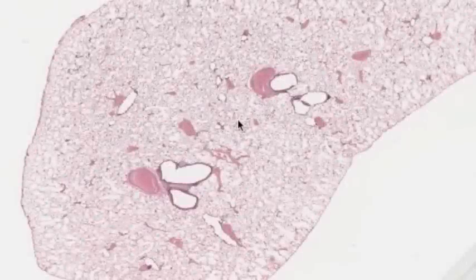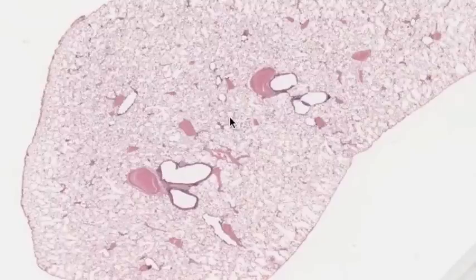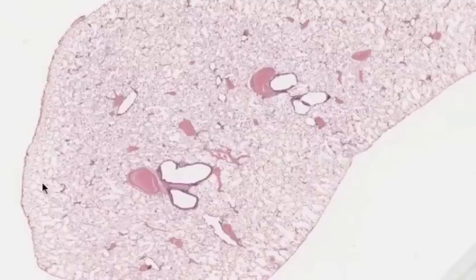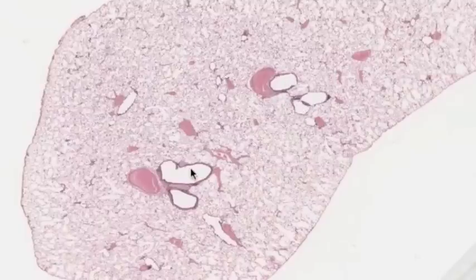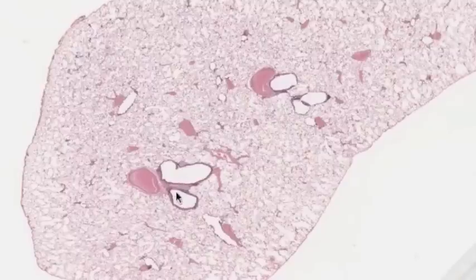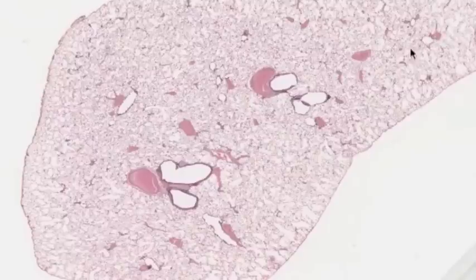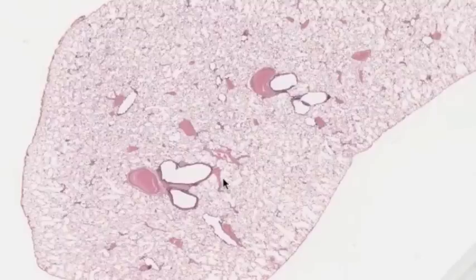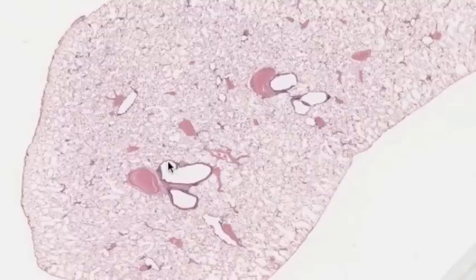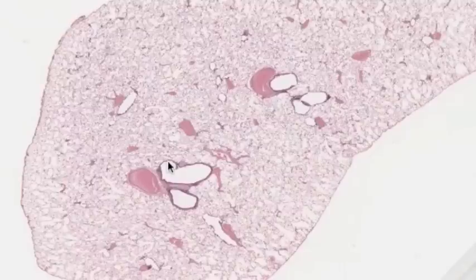Now we're going to look at a lung tissue slide taken a little further out from the hilum. On first glance we see vacuous-looking tissue filled with air spaces, and embedded within that are some larger openings — these will be either bronchi or bronchioles. Accompanying these and dotted throughout the lung tissue are reddish-pink spaces containing blood trapped in blood vessels. The general rule we'll apply is: if there is any cartilage present in the wall, we call it a bronchus; otherwise it's a bronchiole.